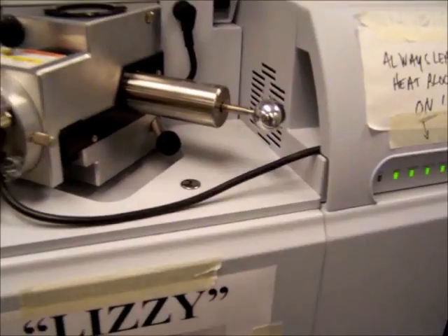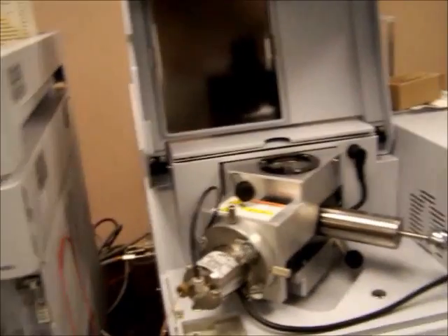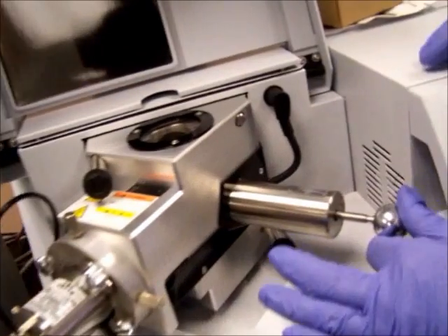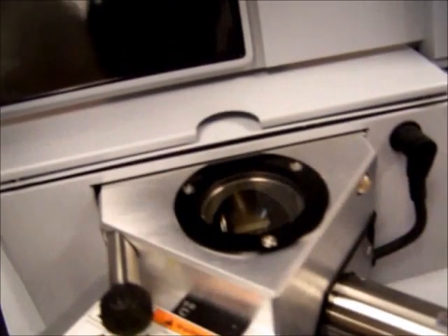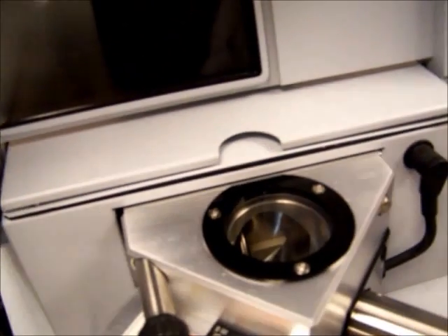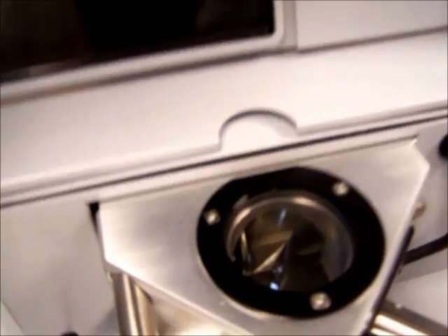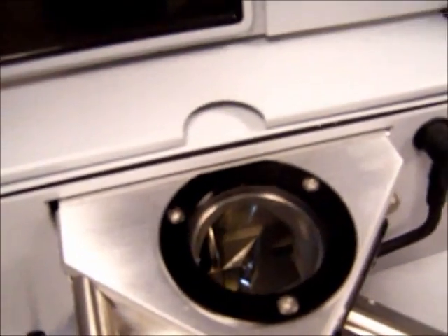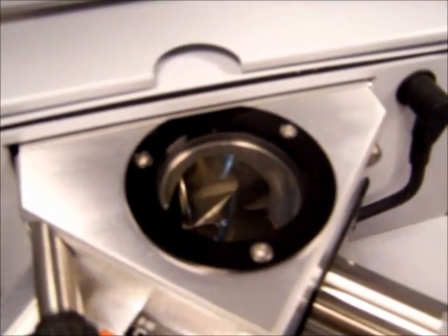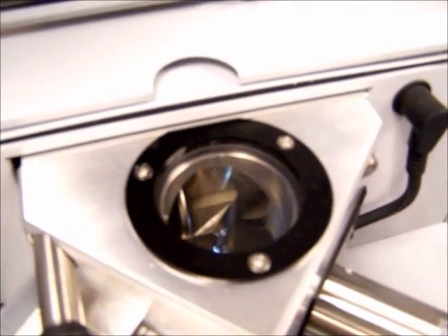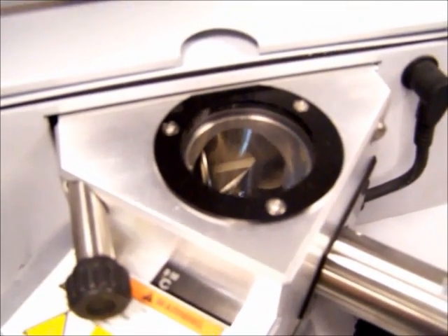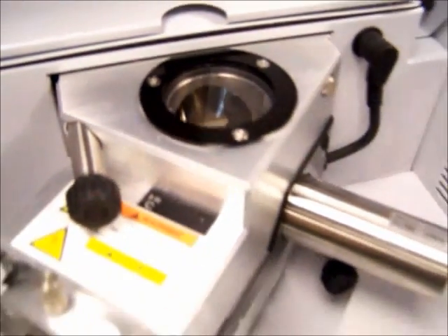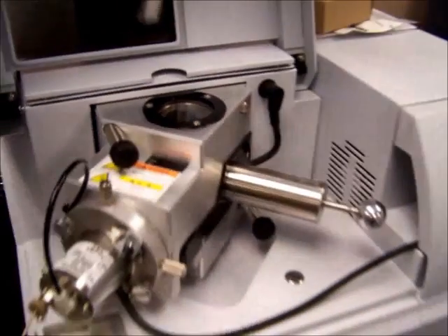If you look through the window, you'll be able to see the shutter. You can see the probe, the shutter closing and opening the probe. This will allow material in and out of the mass spec.